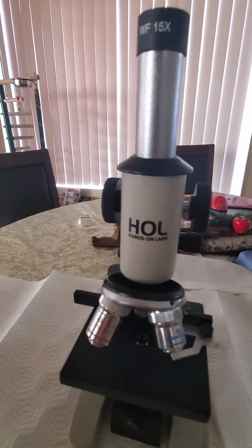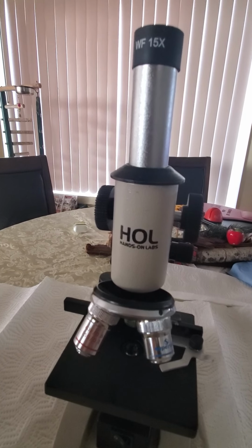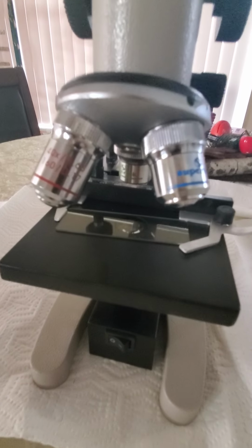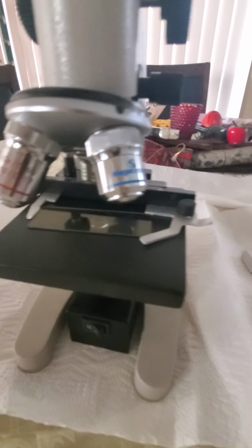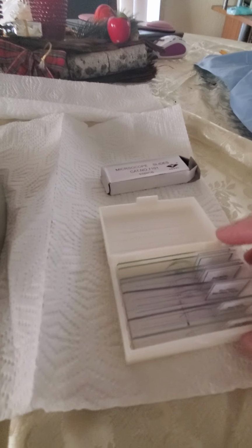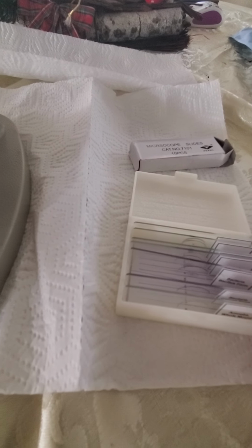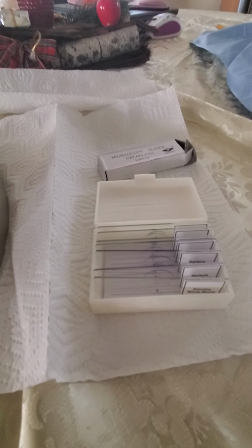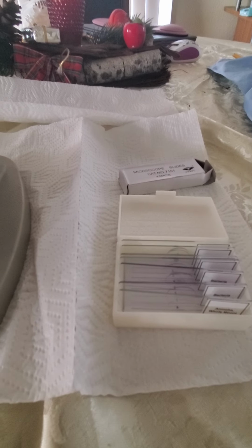Okay, so those are the pieces of our microscope, and now allow me to show you one of the samples that we're going to be viewing. So here it is. You can see there is a piece in the microscope. These are our boxes that are labeled with the different objectives, bacteria that we're going to see, like the amoeba, whole mount, and so forth. So we have a couple of them that we view through the microscope.